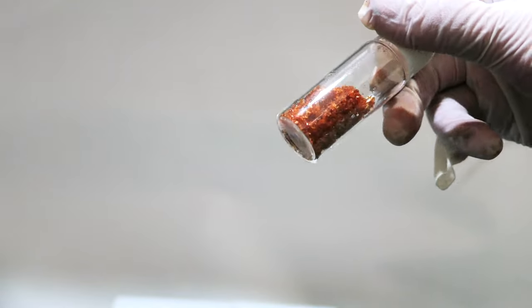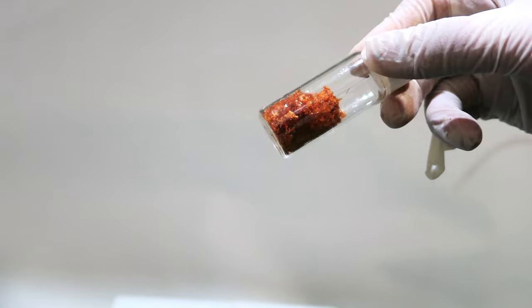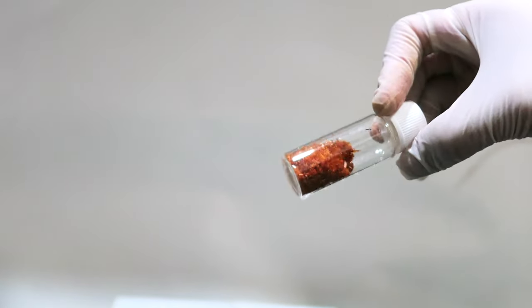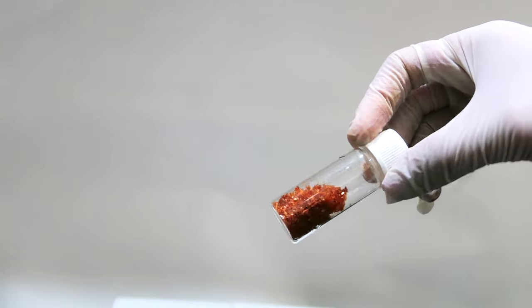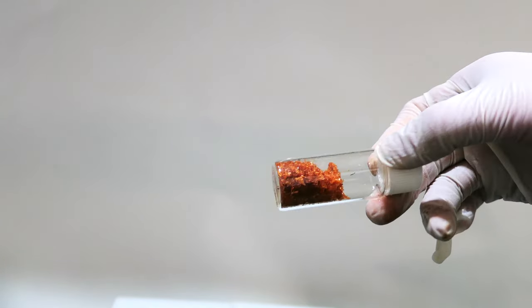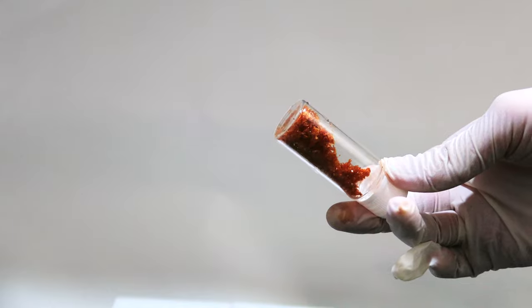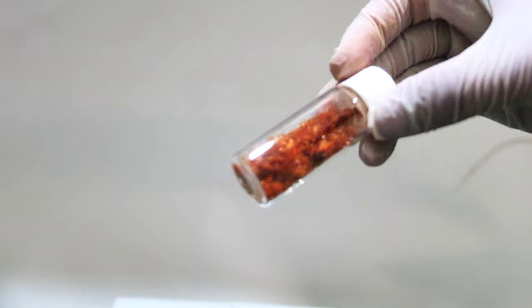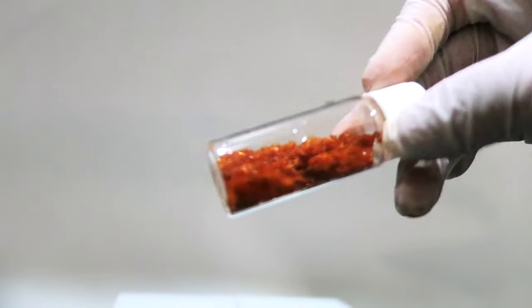In this experiment, the metal is brought into the +3 oxidation state in a stable complex which exists in aqueous solution at high pH. This +3 oxidation state of copper is remarkable because it's completely stable in aqueous solution.